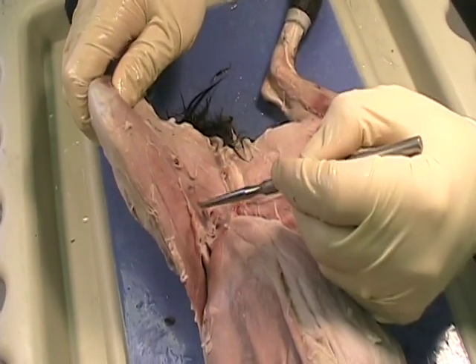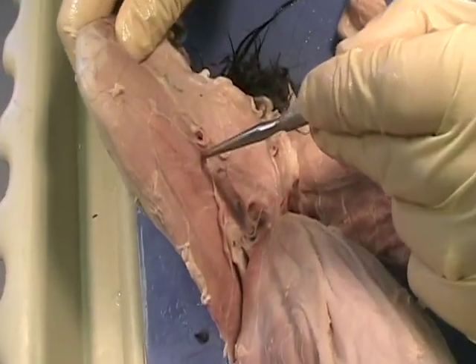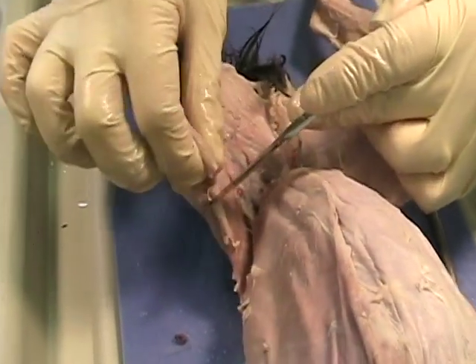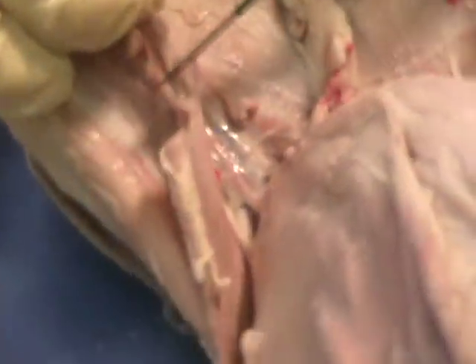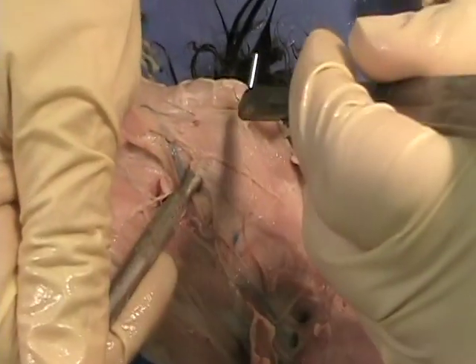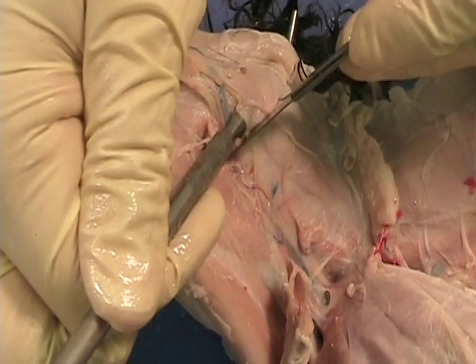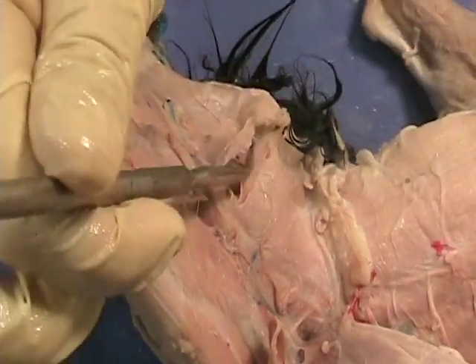What we're going to do to make our first incision is cut all the way across the sartorius, and we're going to cut across the gracilis. We're going to cut this all the way through. I should really cut away from myself, especially while I'm videotaping myself making an incision.